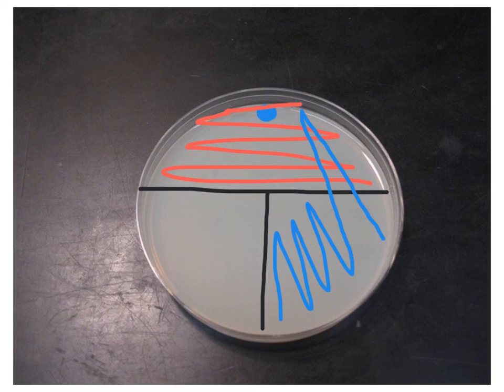I'm going to turn my dish again and flame the loop. We're going to flame the loop because now I'm wanting to take the bacteria that's been placed here and dilute it down. Because my flame loop does have bacteria on it, I need to kill that bacteria. I need to let it cool, and once it's cooled, I'm going to take my flame loop and come across like this one time, and then back and forth so that I have diluted my bacteria down as much as possible.